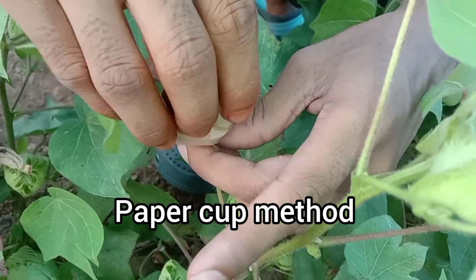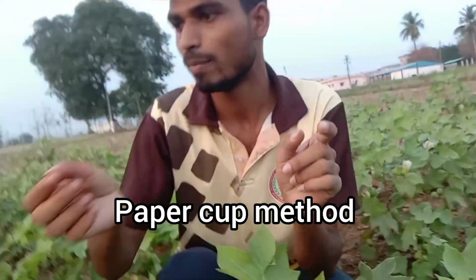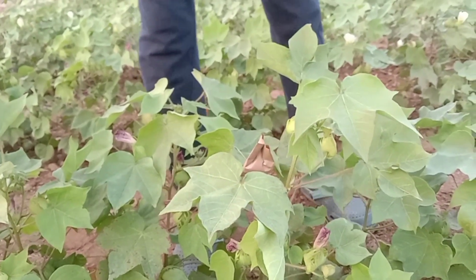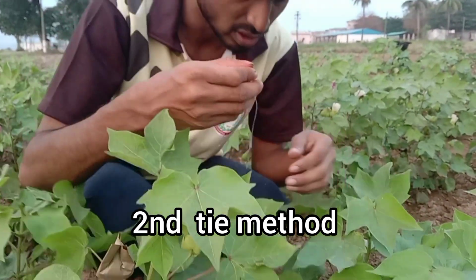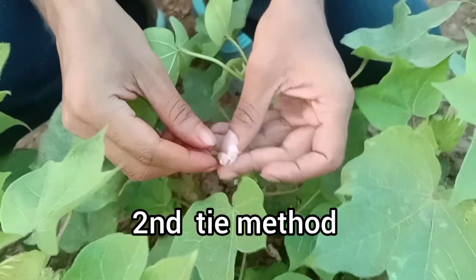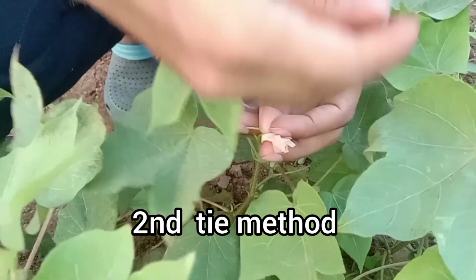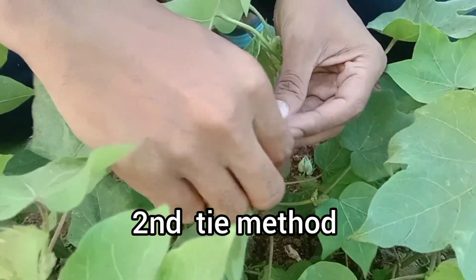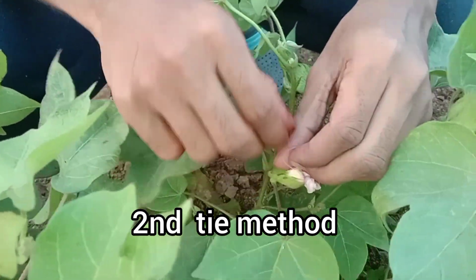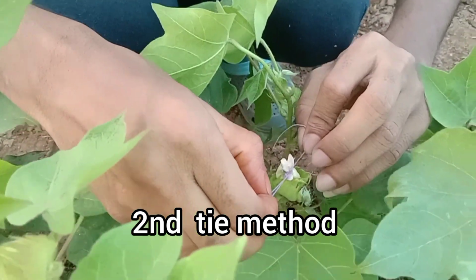So the flower is covered. And the second method is tying the flowers with thread. Only the upper portion of the flowers, whose petals will open the next day, is to be selected, and they should be tied with a thread like this. So it will prevent outcrossing, and there will be only the choice of self pollination. These are the two methods of self pollination in cotton.